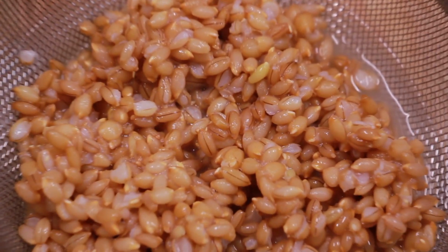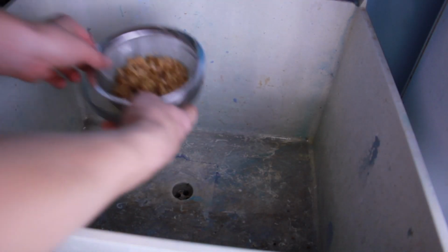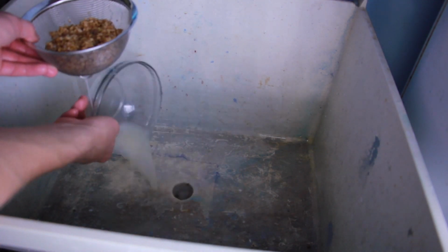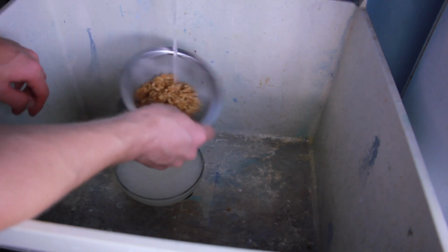You see the grain looks pretty soupy right now. It's pretty sticky on the outside of the grain, and I think that's just a result of the grain skin breaking down under the lacto fermentation.